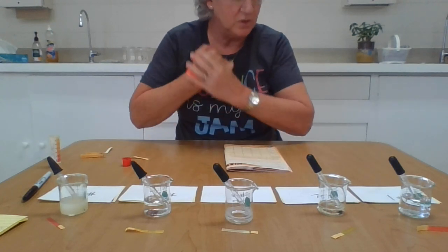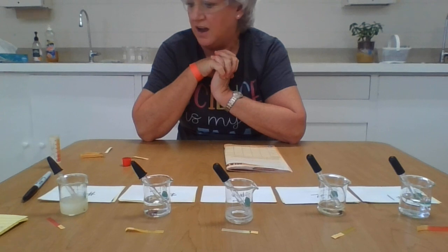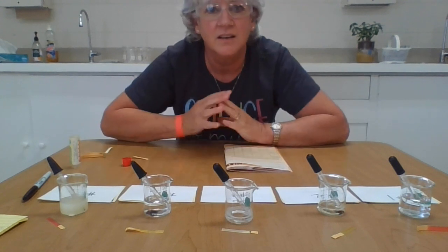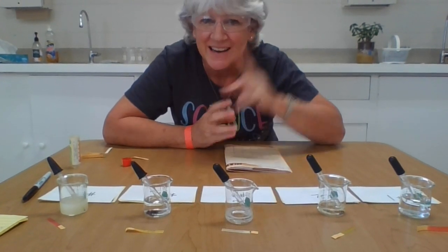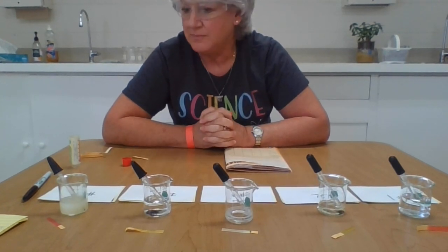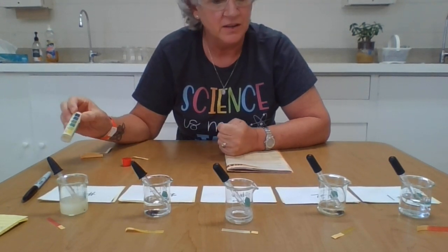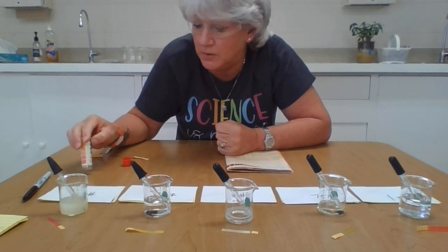All right, so let's go ahead through these. Number 1, it was a hot pink color, and it was a pH of 1, so that would make it a what? An acid. You're right, good job. Number 2, it turned that yellow, that perfect neutral 7 color, perfectly neutral. It's not acid or base, it's right in the middle.